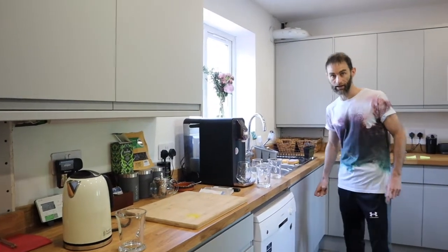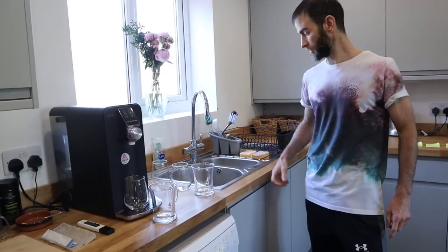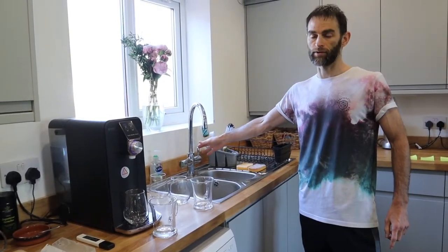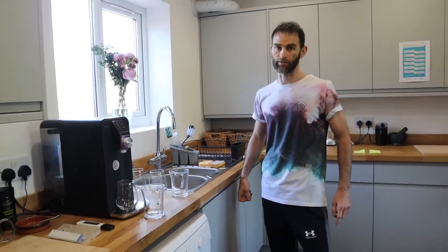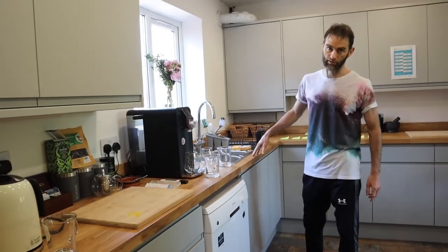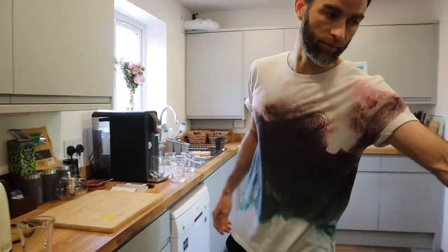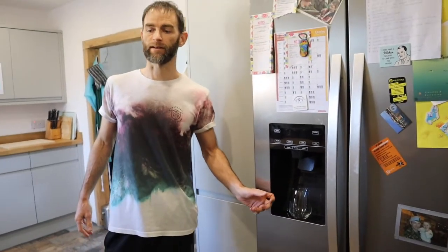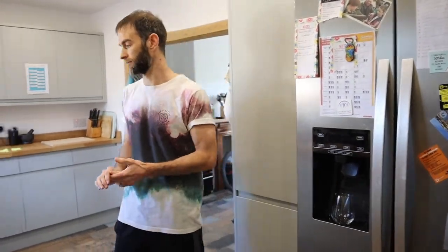We've also recently had an under-sink boiler fitted — it's a three-in-one tap with filtered water, tap water, and boiled water. I'll be testing that as well, because over time these break down and manufacturers don't let consumers know, and there's no servicing schedule. We've also got a tap filter and a fridge filter here which is 0.5 micron, which we'll be testing as well.